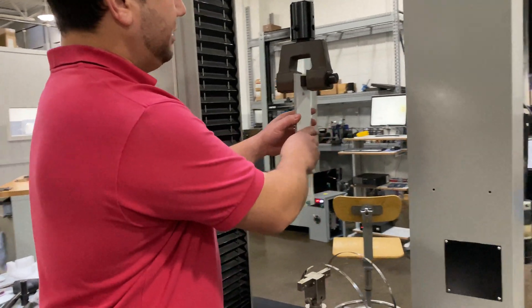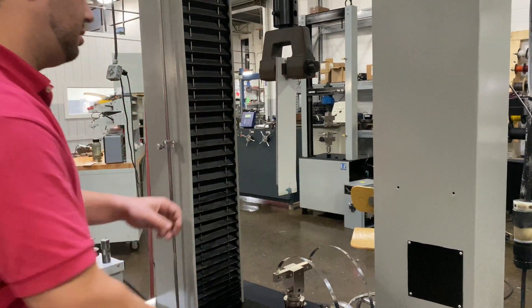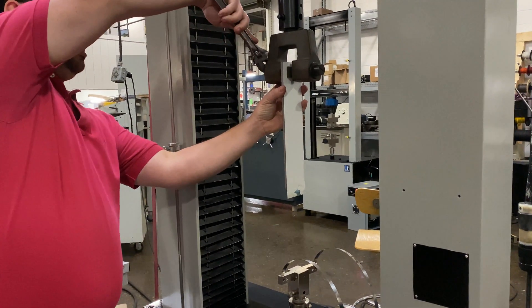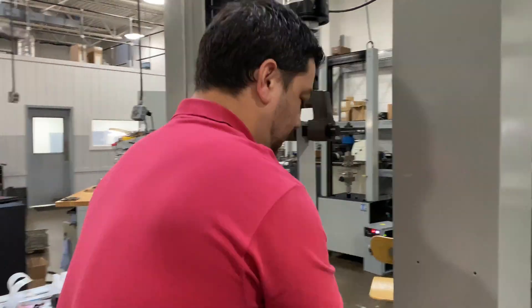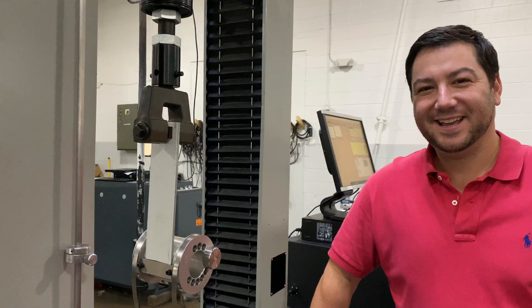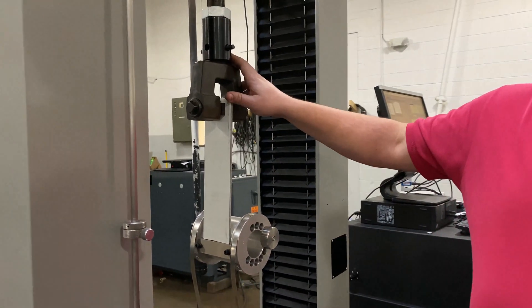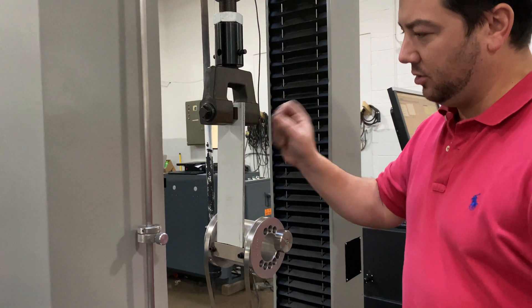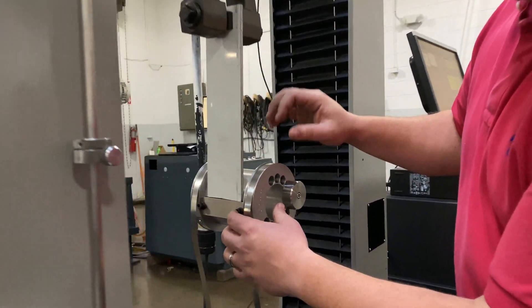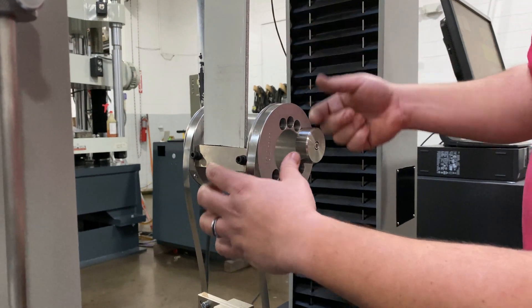So how we're going to start — we have the side action grip here that we're closing in. We have the top side action grip holding the whole specimen itself, and the climbing drum simply clamped to the back laminate plate itself.